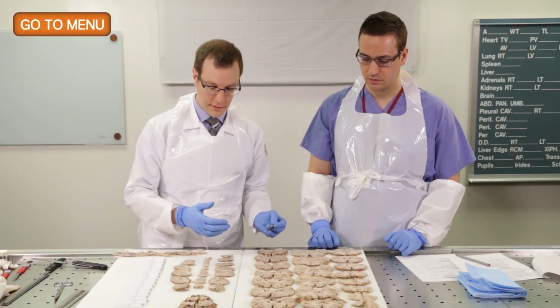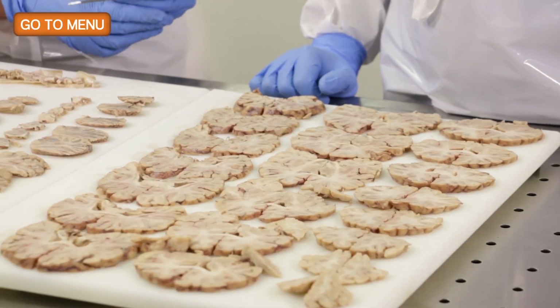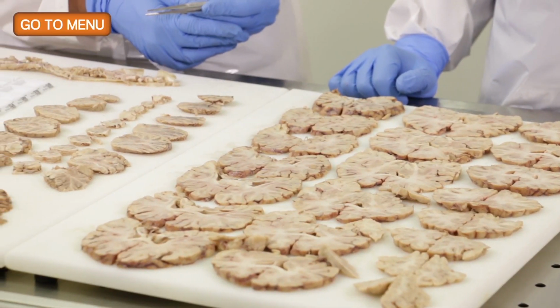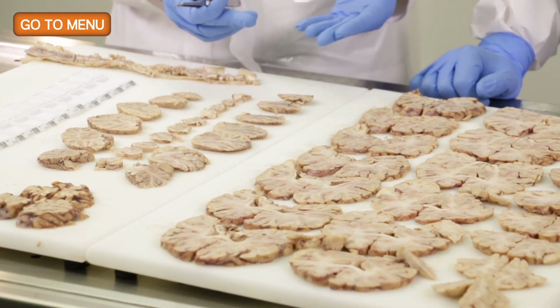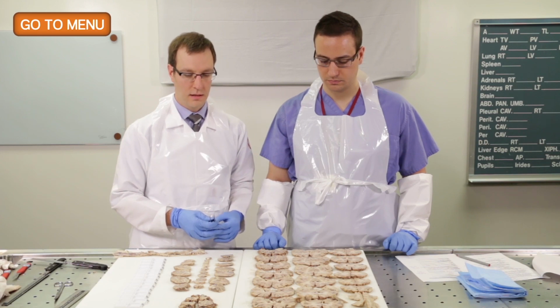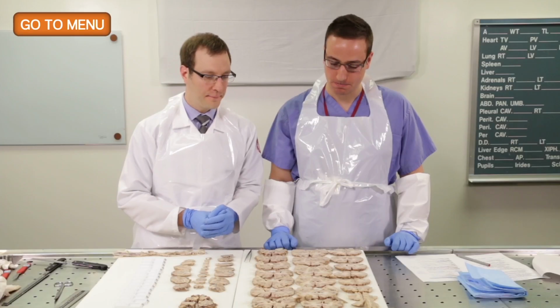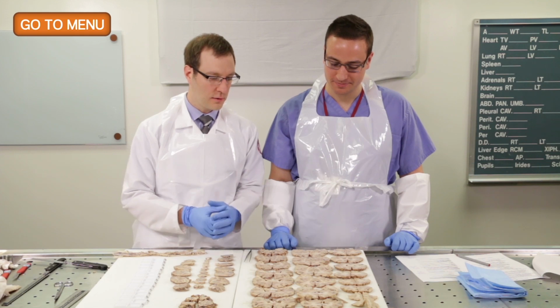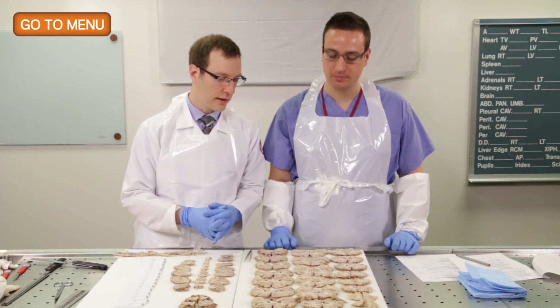So other than that, we took a close look before we started recording, and we don't really see many other lesions here. So at this point, we would take both our standard sections of the brain in addition to sampling specifically lesions that we grossly identify. So usually we take 10 sections of the brain, including the pituitary and the spinal cord, and we sample different areas of the cortex and non-cortical, neocortical areas.